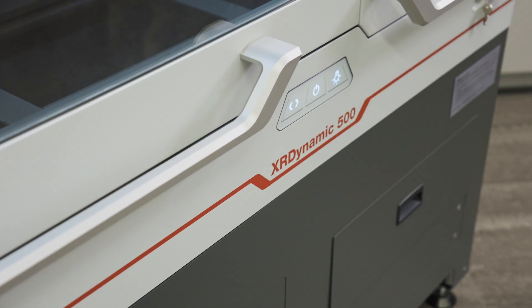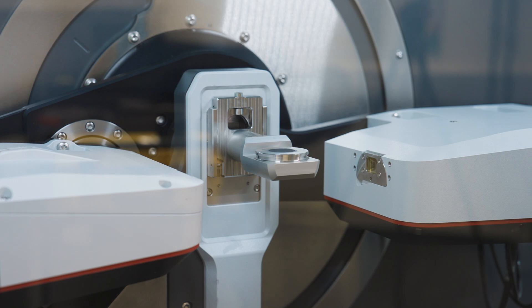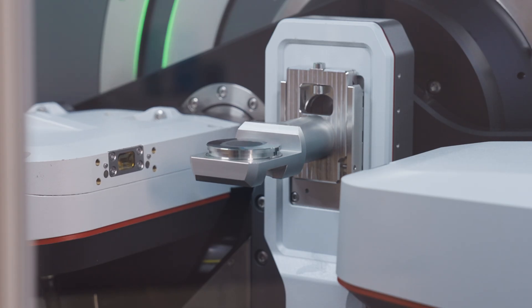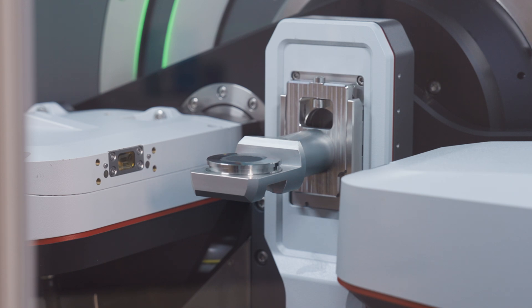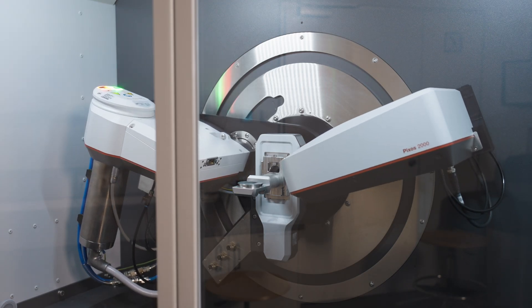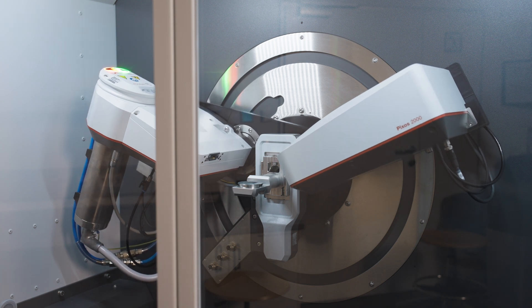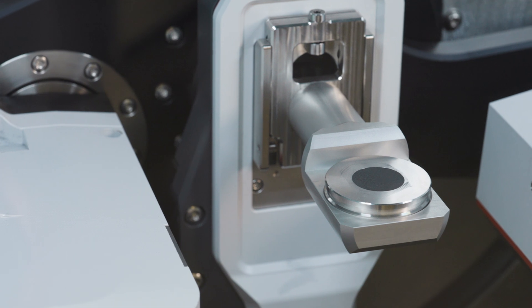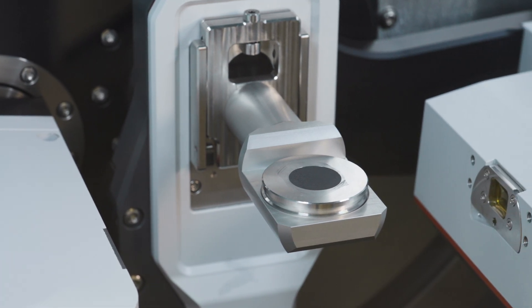In an XRD instrument, many factors affect the sensitivity of the measurements, primarily the radius of the goniometer — here the larger the better — and the sensitivity of the optics. There are also different beam geometries and optics to choose from, such as Bragg-Brentano, various monochromators, and focusing or parallel X-ray mirrors. Here we are going to perform measurements for a well-prepared graphite sample with both Bragg-Brentano as well as parallel beam mirror geometries.